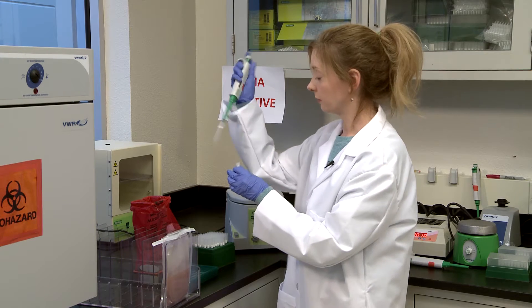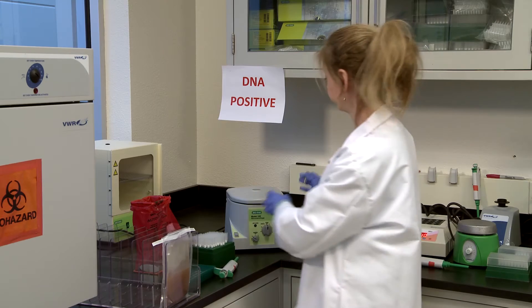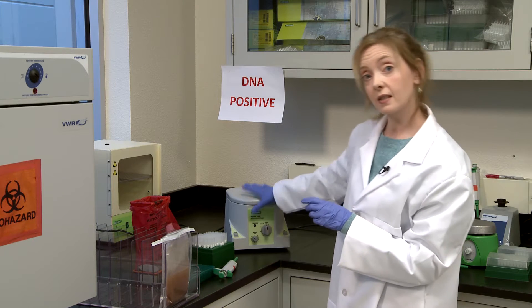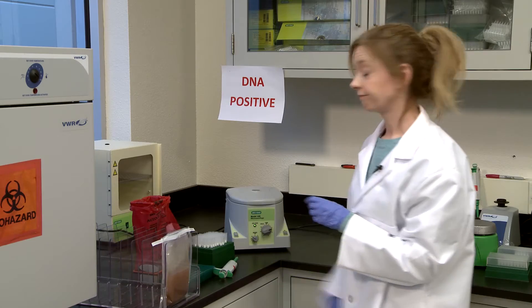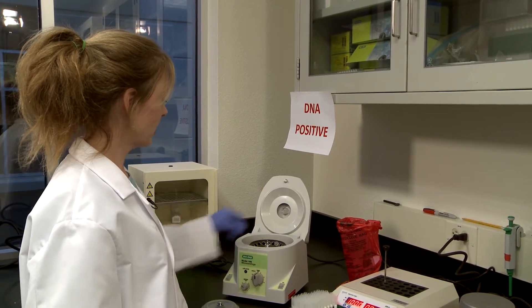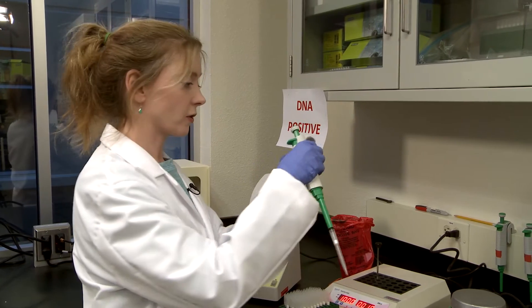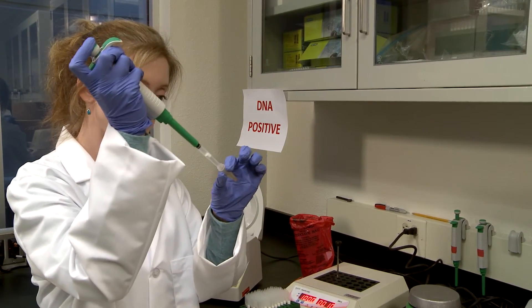Screw on the lid. Our next step is centrifugation — that goes for five minutes at 10,000 to 12,000 G's. Your sample has finished spinning. Now let's remove the supernatant — you've got to be careful, you don't want to dislodge the pellet that you just created. There we go, take out that supernatant.